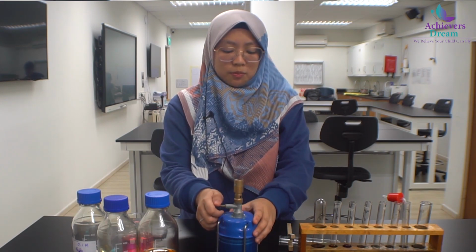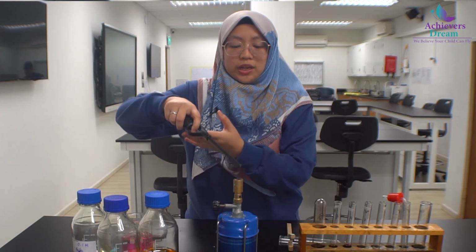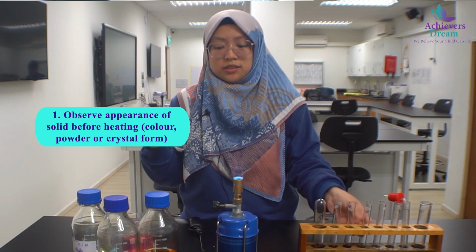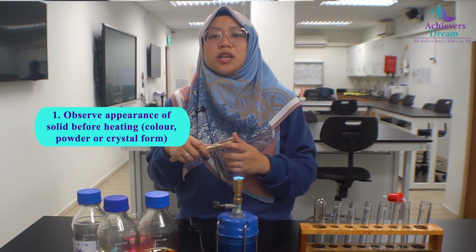Alright, so the third test and the hardest test to score is actually the heating of solid samples. Now, what you need to take note of when you are heating a solid sample is the appearance of the solid before you heat. So in this case, it is a white powder. Appearance meaning the color as well as whether it is in crystal form or powder form.